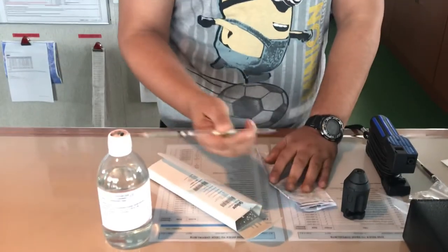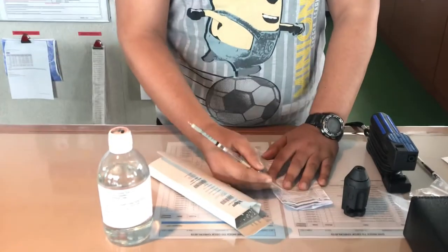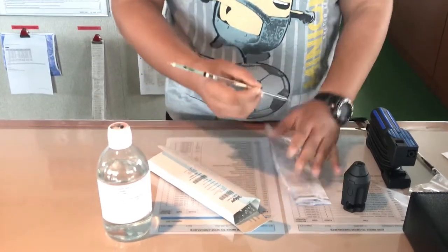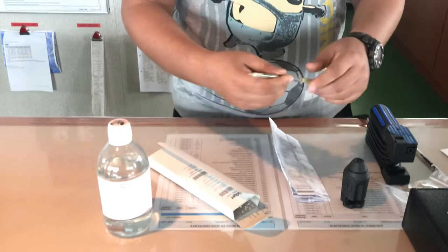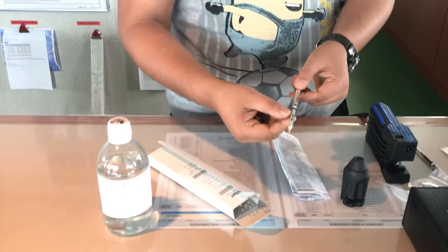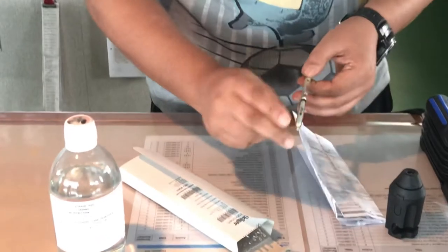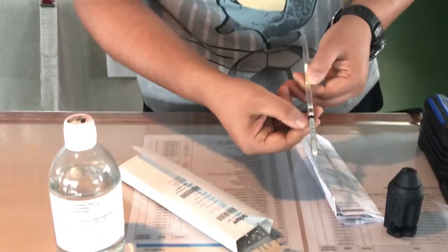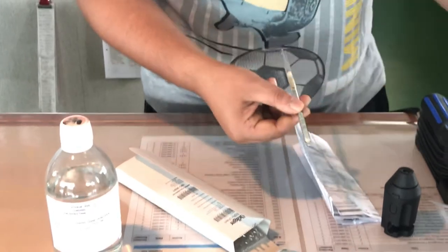The accuracy range of the tube is plus or minus 20 to 30 percent. The color change — since it is a green color tube — it will change to brown at around the ppm level that is being detected.